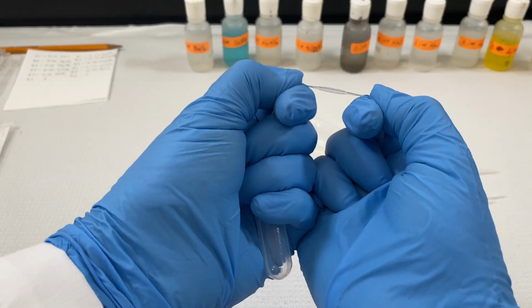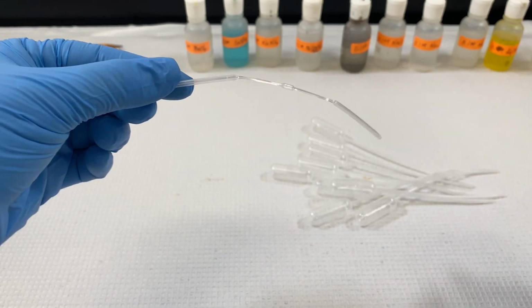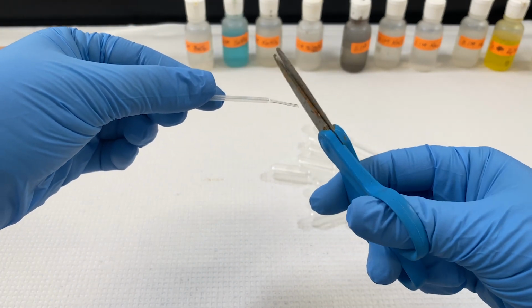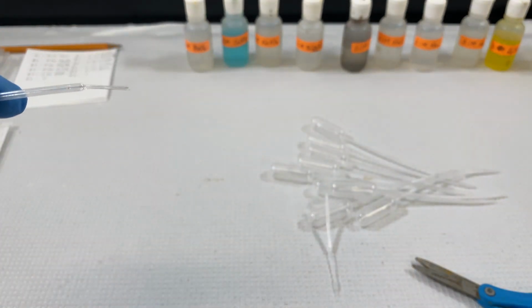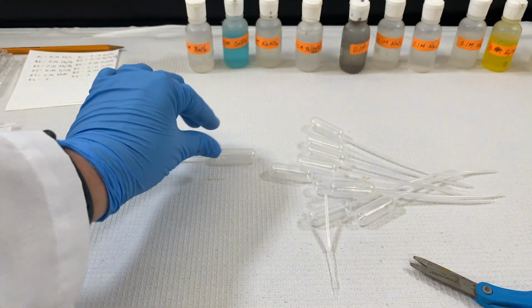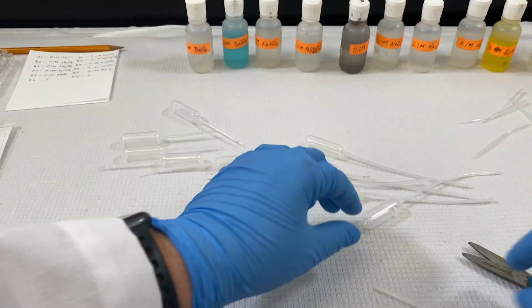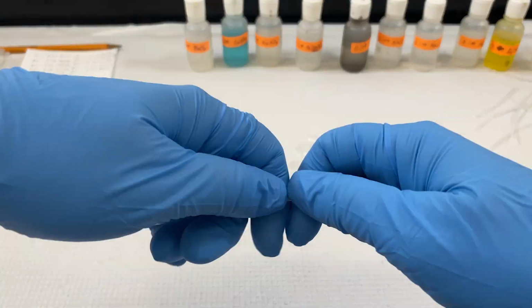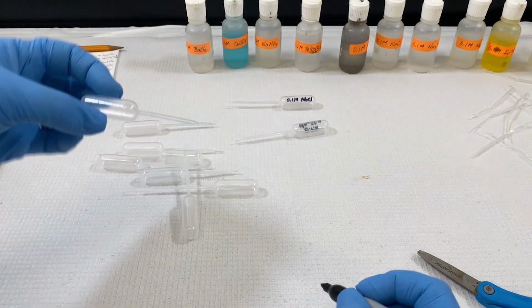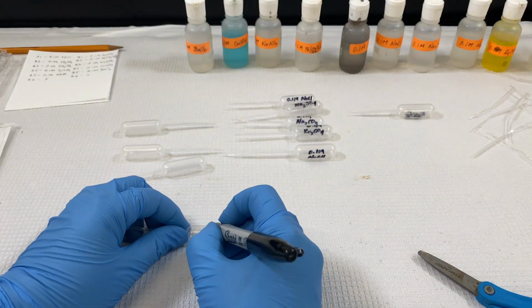Now we're going to put drops of each of those on that reaction grid, but to do it we need a very, very small drop, and so we're going to use what's called a pull pipette. We have stretched the pipette, and then with scissors, about a ½ inch or so below where it first thinned out, we make a 45-degree cut. We will do that for 10 separate pipettes, given we have 10 reagents we're going to use. And so we don't get them confused, we're going to label each of those 10 pipettes.